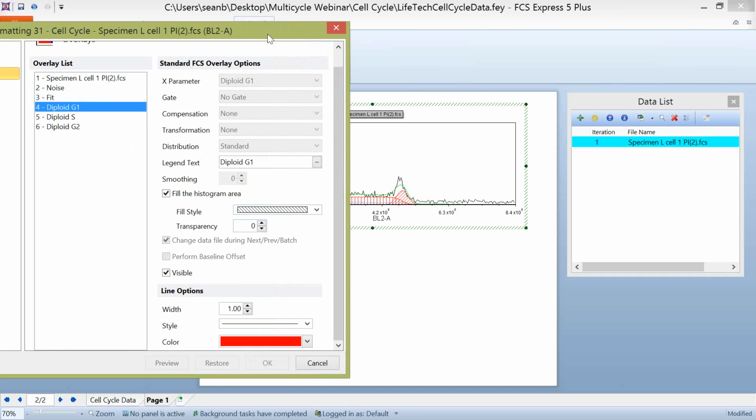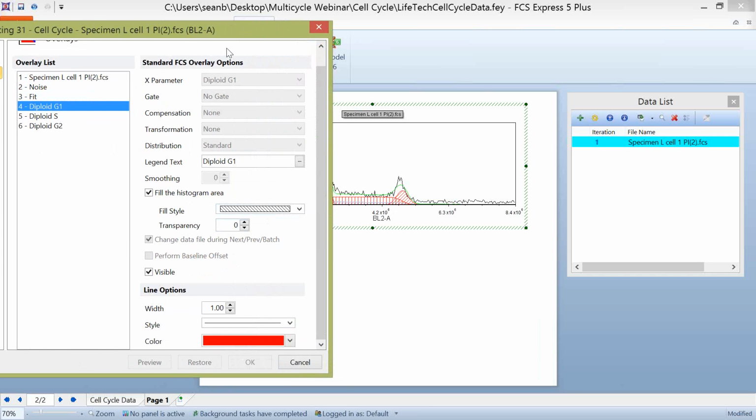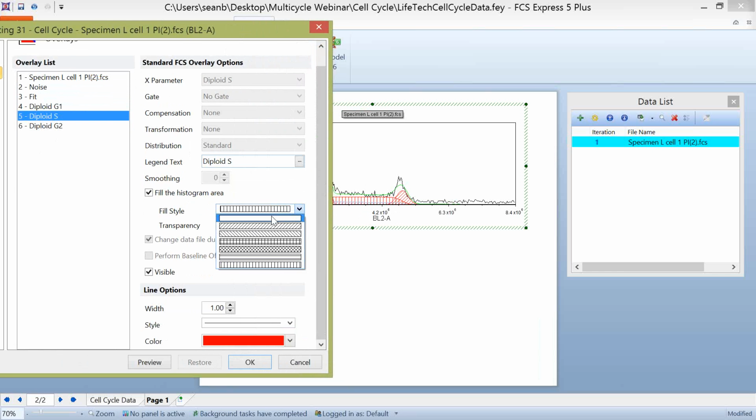Now, one nice thing you can do in FCS Express, again, this kind of comes into reporting of the data. We don't have to use the defaults that we use here, and you can even change your defaults so that every time you open up a plot, the way that you want to view this data is happening. But generally what I like to do with my multicycle plots is I change the fill style to something that's just full rather than a hatch mark.